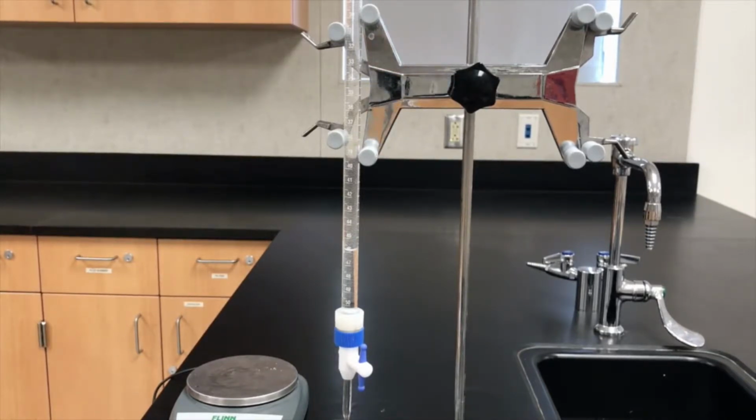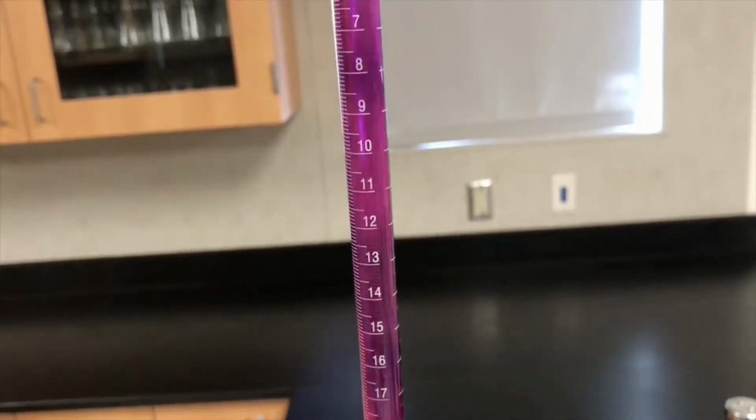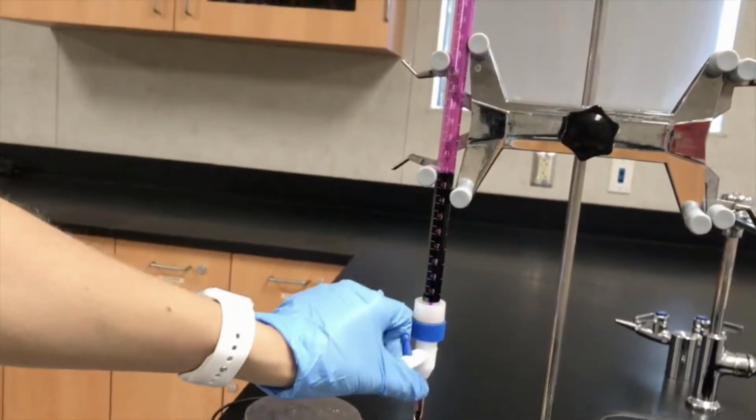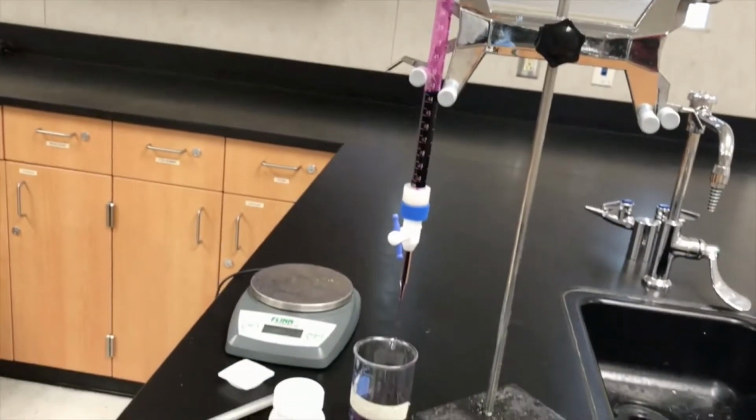All right, so these are steps that you have to complete before you ever start a titration. It's going to be a little bit of waiting for this volume to go all the way down. So now I'm going to pour a little bit of potassium permanganate in there in order to make sure that my solution isn't too dilute. Okay, I'm going to turn the stopcock, and I'm going to allow all of that to flow through as well. You can see that flowing into my beaker.